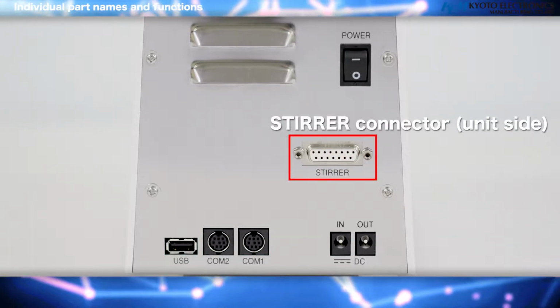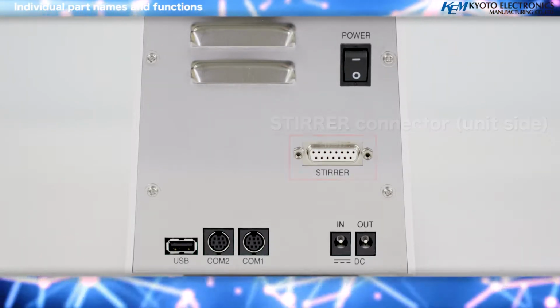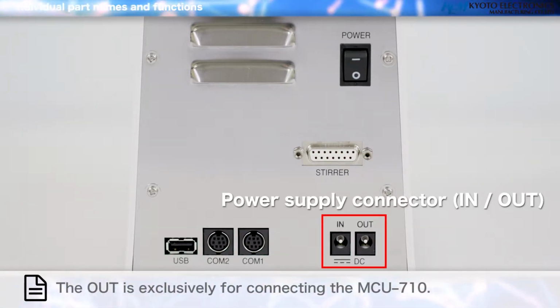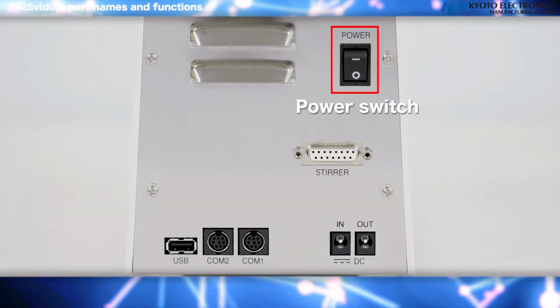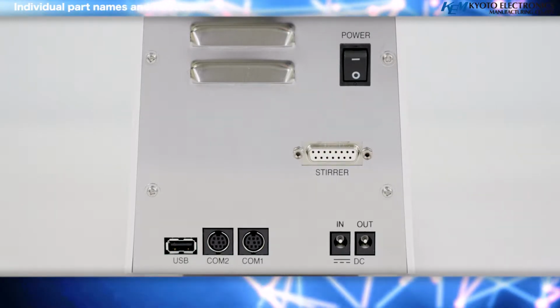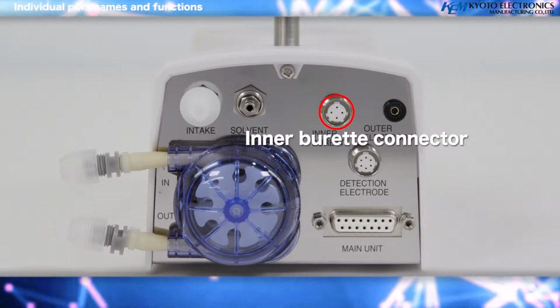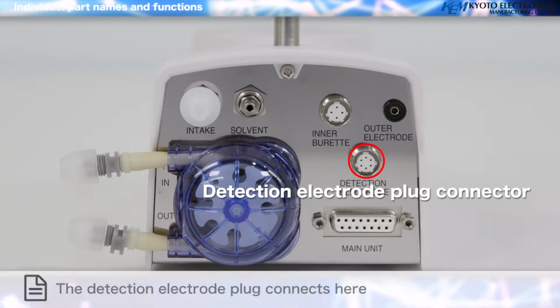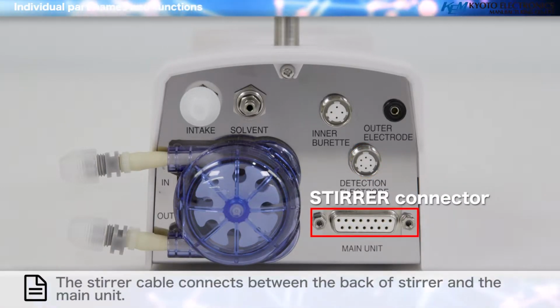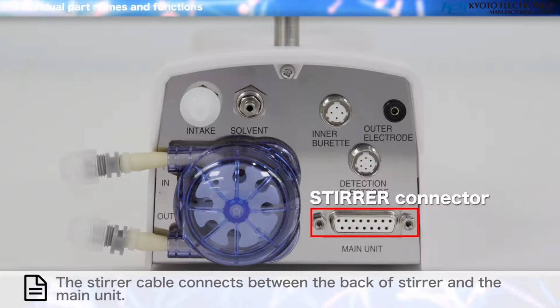Stirrer connector, unit side. The magnetic stirrer that stirs the sample solution connects here. Power supply connector, in, out. The power cord connects here. Power switch. This switch turns the power supply of the device on and off. Inner burette connector. The inner burette plug connects here. The detection electrode plug connects here. Stirrer connector on the stirrer end. The stirrer cable connects between the magnetic stirrer and the main unit.